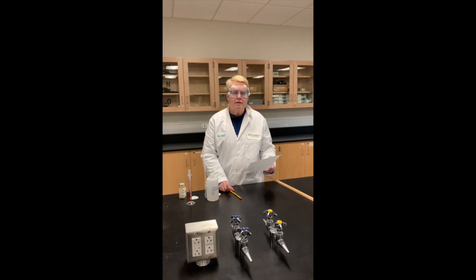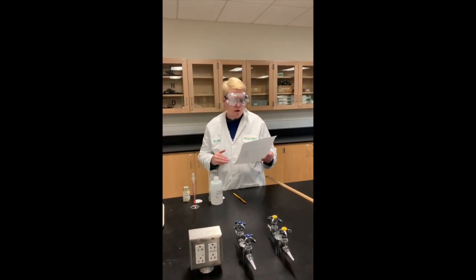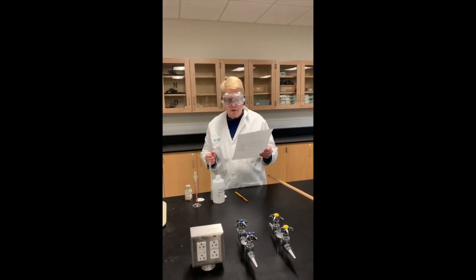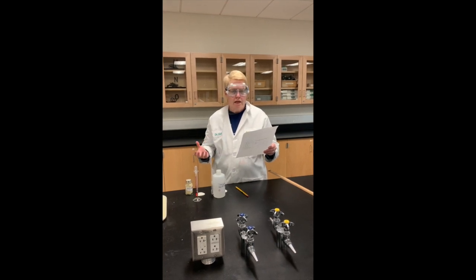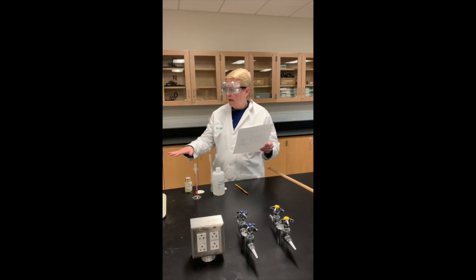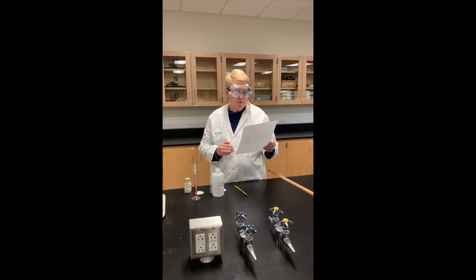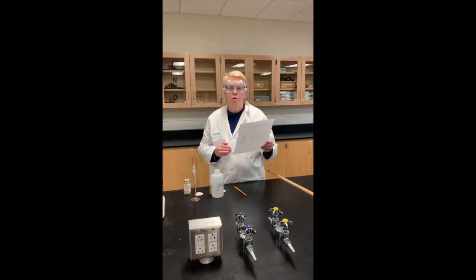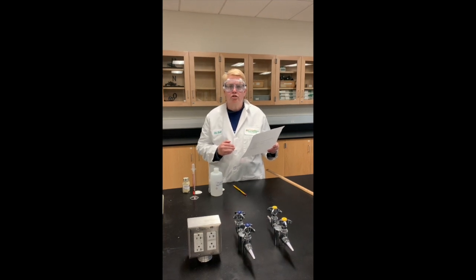So we repeated the experiment 3 more times in terms of counting the drops. In trial 2, the number of drops was 38. Trial 3, the drops were 39. And trial 4, the number of drops was 38. Remember, these are the number of drops you have in a milliliter. When we added the drops to our tray, in trial 2, the diameter was 23.4 centimeters. And in trial 3, the diameter was 22.1 centimeters. With this data, you should be able to do the remaining calculations for the experiment.